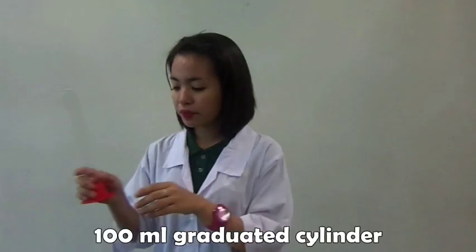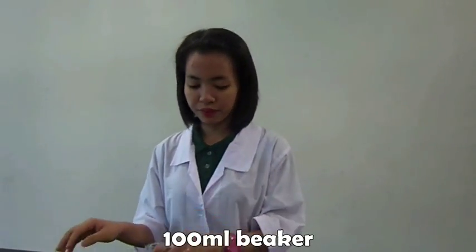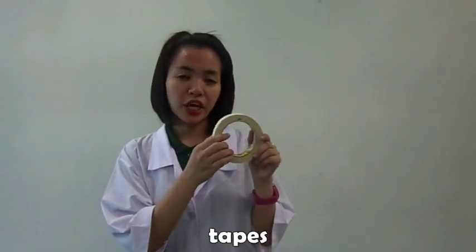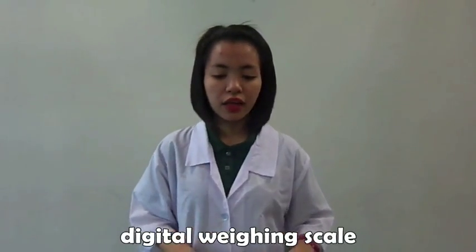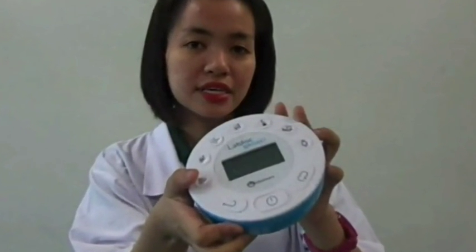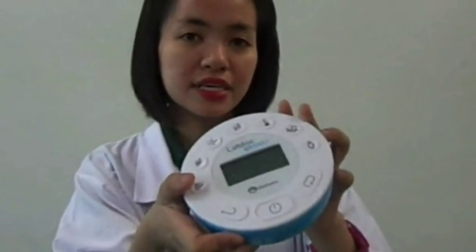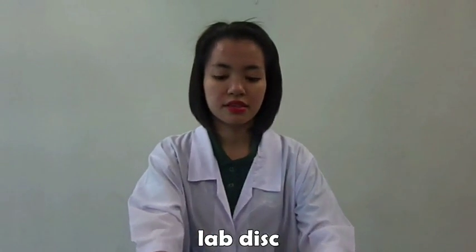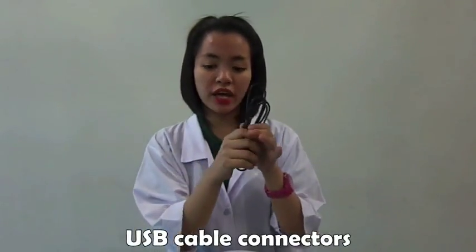The materials that we are going to use are a 100 ml graduated cylinder, a 100 ml beaker, a stirring rod, masking tape for labeling, a digital weighing scale, and the lab disc. This device will help us to easily measure the accurate variation of pH of different types of soap. This also needs a USB cable connector and the pH sensor.